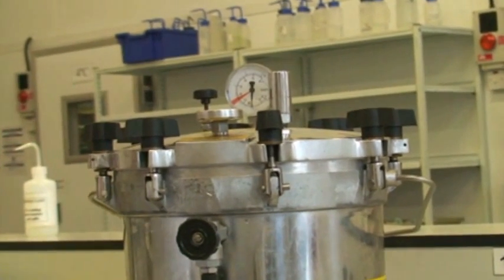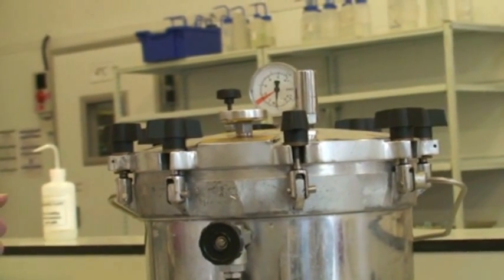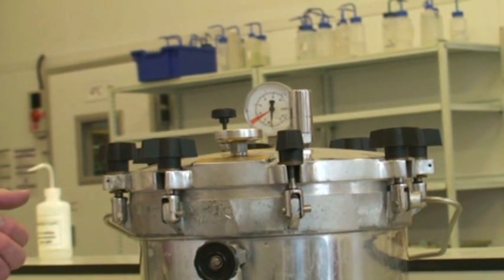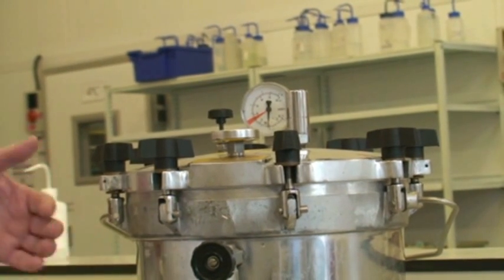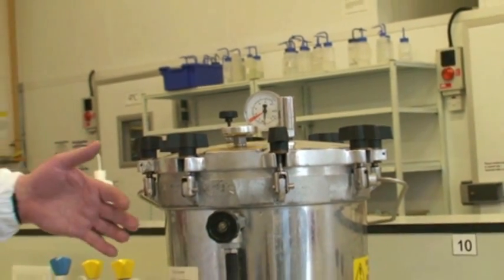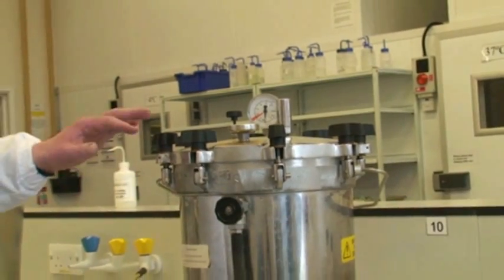The reason for this is you need to purge the air inside the autoclave so that the atmosphere becomes steam rather than hot air. This will ensure proper sterilization of the items you've got inside.